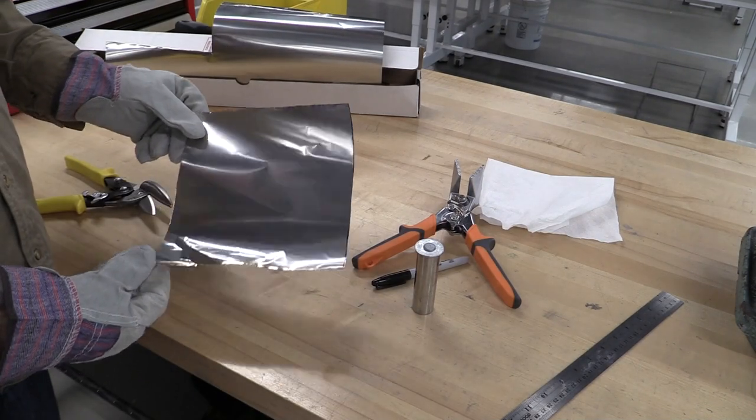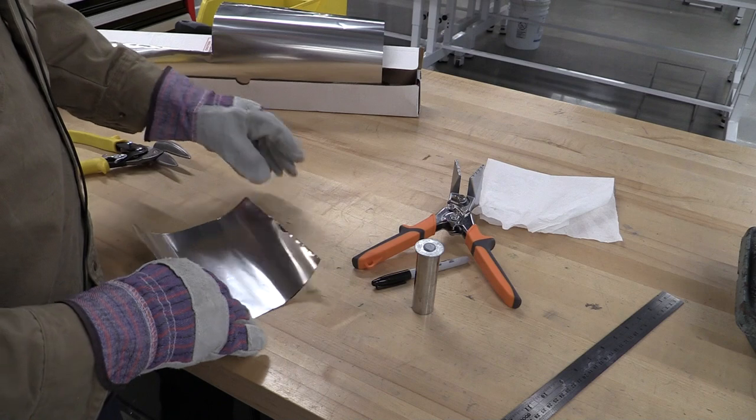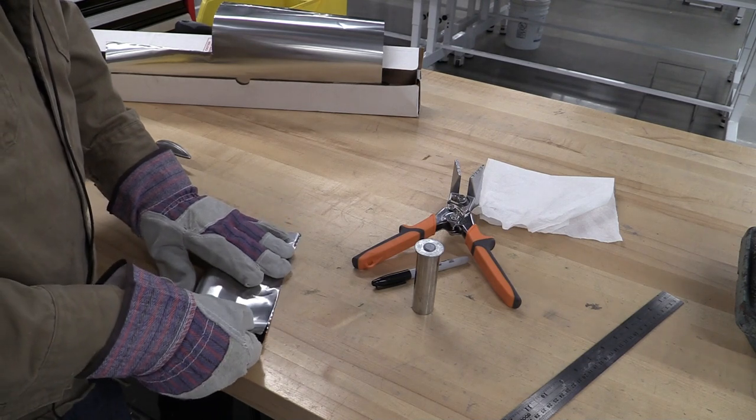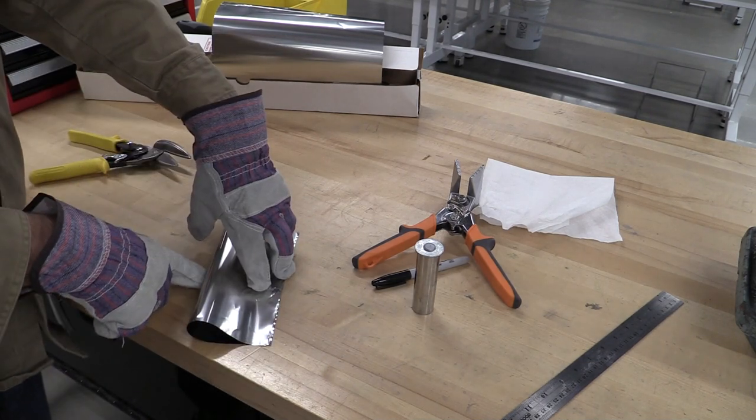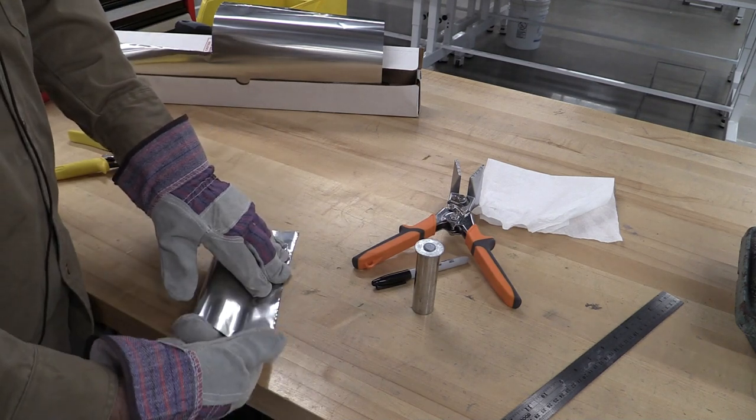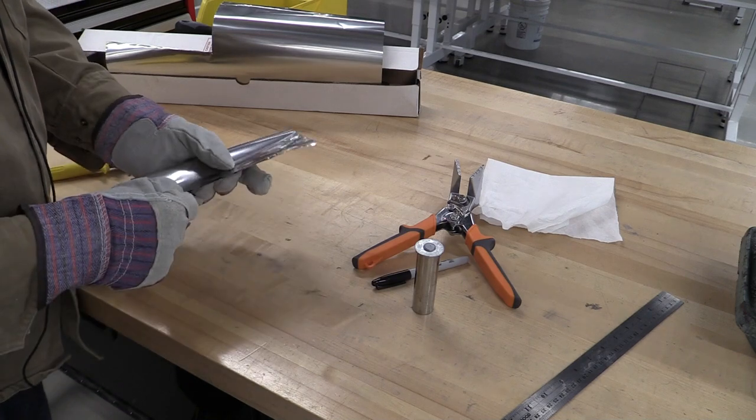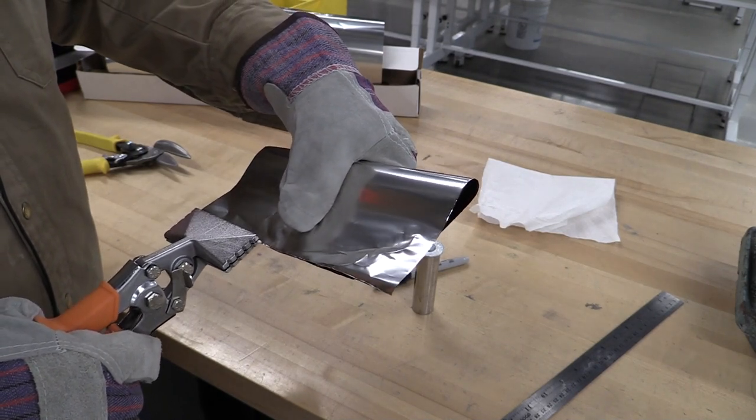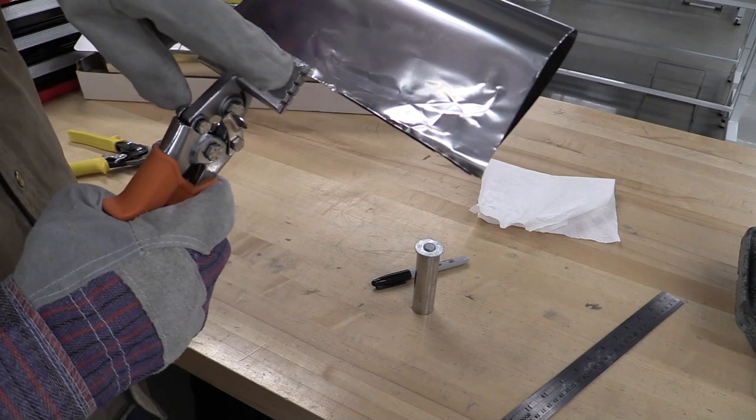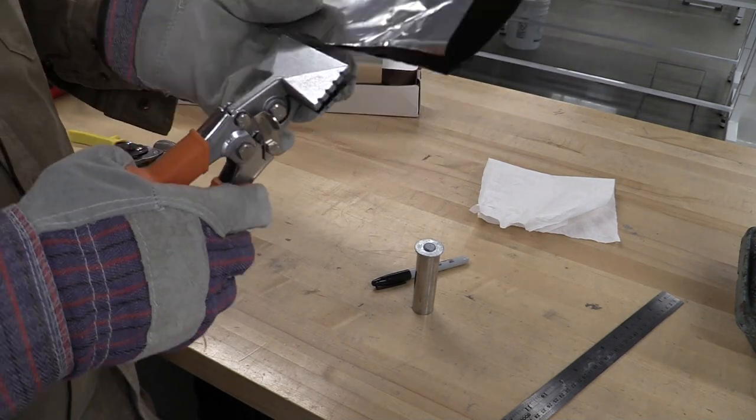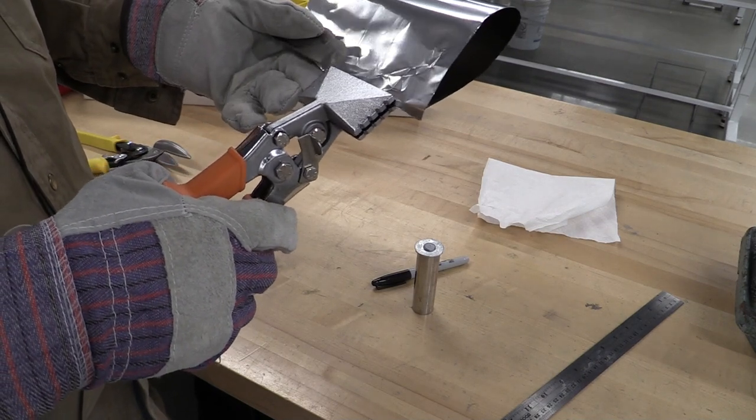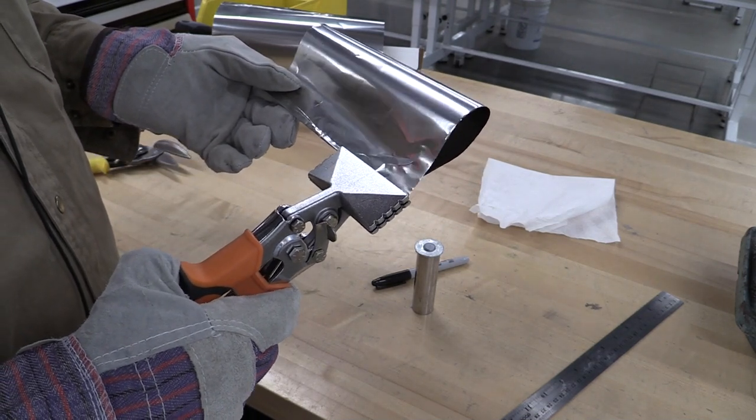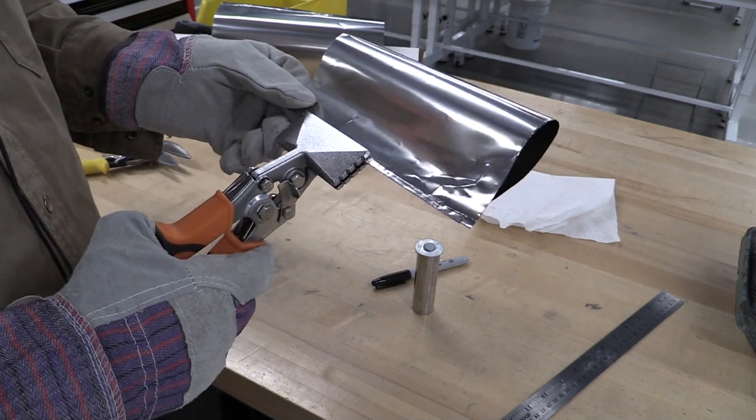I just cut out my 8x8 piece of stainless steel, still keeping my gloves on. We're going to line up the lines where the corners match up and fold it exactly here. We don't want to fold this flat - we're going to do a double fold on this edge. Get this up close and use these tools, getting about half a notch to a notch, and I'm going to bend that over. I'm working my way down, making sure I have each piece on there. I've bent it over and have my first seam going across. I'm going to compress that down using this tool, just crushing it down so it's solid.